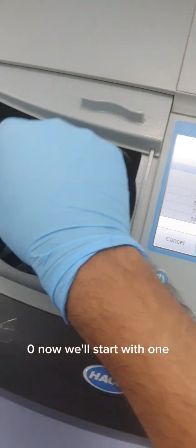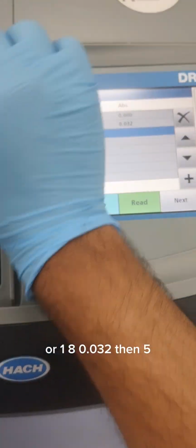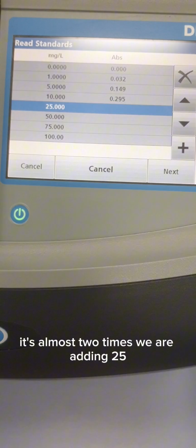Now we'll start with 1. We read 1, so 1 reads 0.032. Then 5. Now we are reading 5. Read 10. It's almost 2 times. We are reading 25, 50, 75, 100.